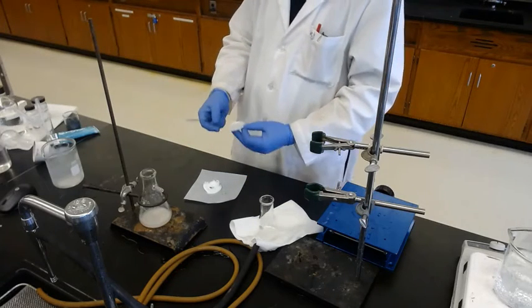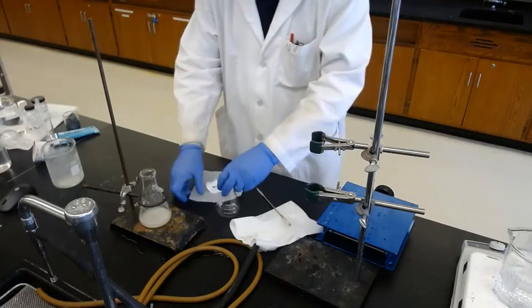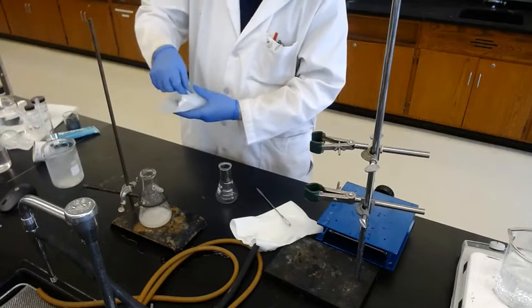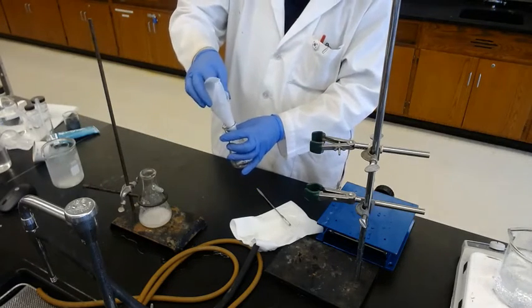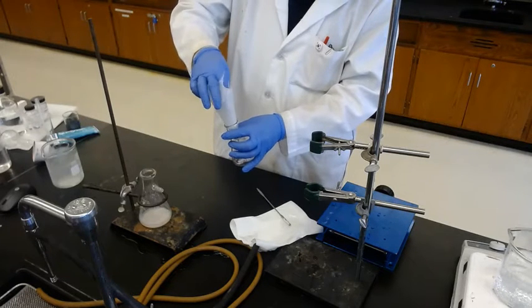Now all the solid is transferred, and then transfer into aluminum. Okay, as I showed at the beginning, you can use the cone, make a cone, and move it. This is the difference.